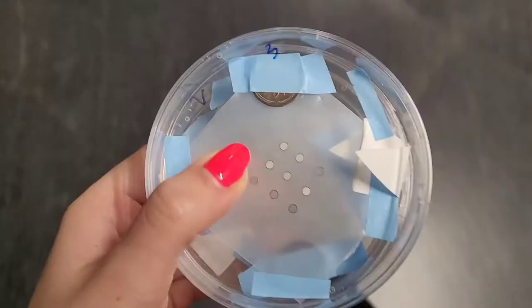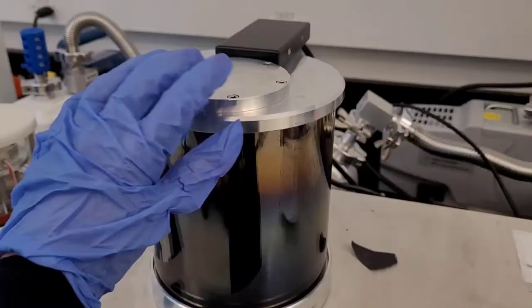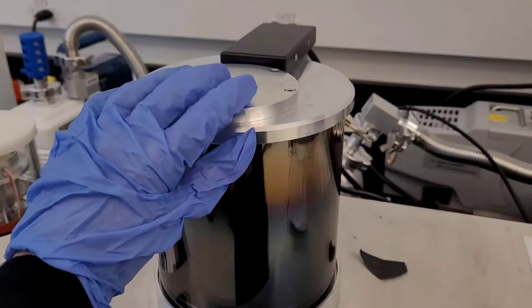You want to make sure you tape the sides, have something heavy like a penny on the side, and a piece of filter paper that's bent just so you can track how much carbon you're depositing.